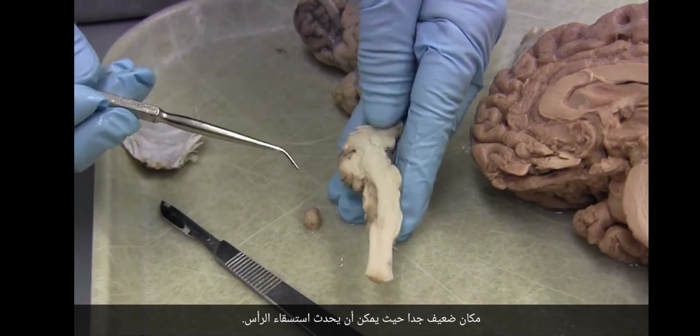Here is the third ventricle. It's a midline structure. Here it is in the sheep. Here it is in the human. Okay, so here's the third ventricle, and this hole right here, that hole goes over, and you can see the probe coming out on the other side. You cannot see it? Okay, hold on. Oh, there you go. Yep, see that? So I went through to the side.